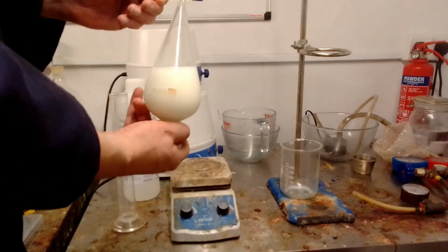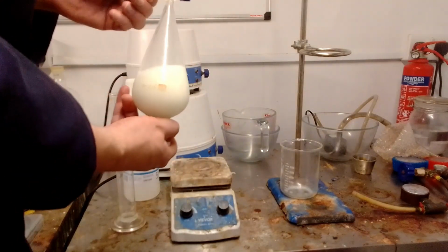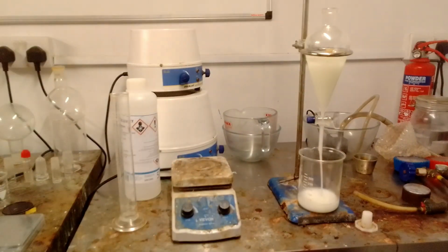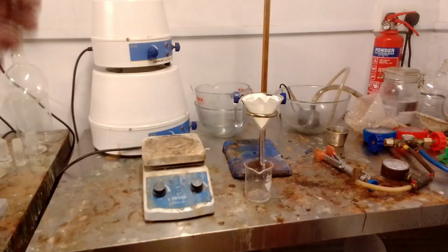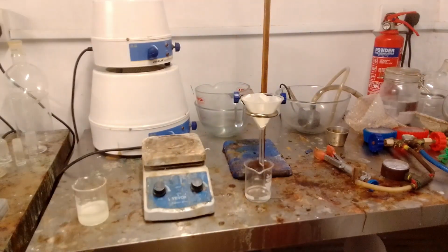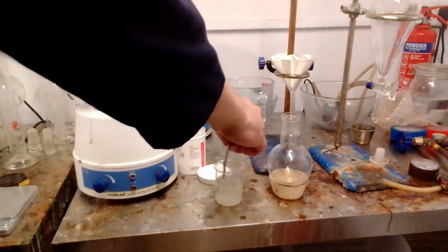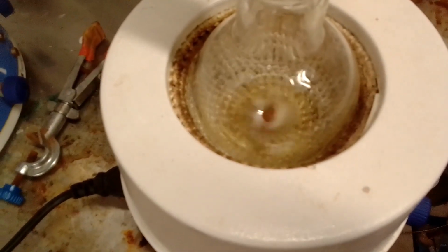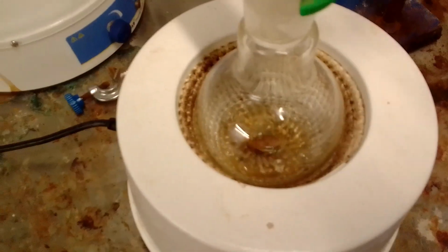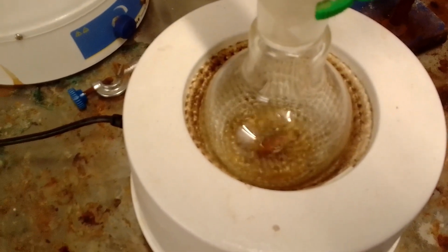The interface between the two phases became increasingly difficult to see as each extraction took place. The combined DCM extracts contained a good deal of water and insoluble material. The insoluble material was removed by gravity filtration. Most of the water was removed using a separating funnel. The resultant DCM extract was dried using sodium sulfate, filtered again by gravity, and the solvent was removed first by distillation and then by vacuum.